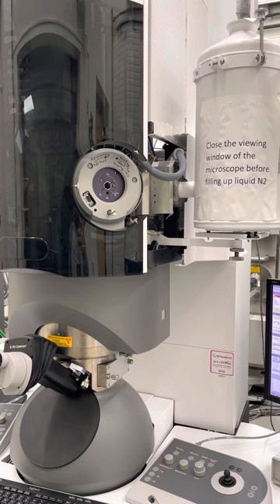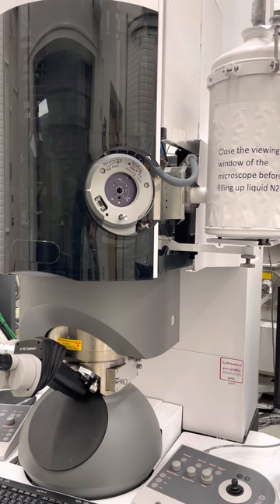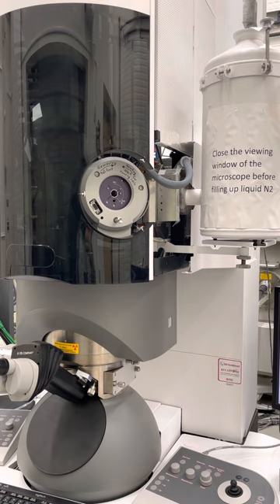When you work at the microscope, the most critical part is definitely inserting and removing the specimen holder. So you've got to do it carefully. If you pay attention at some steps, everything should be fine.